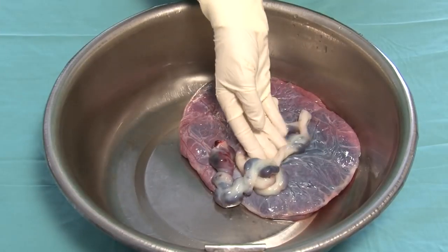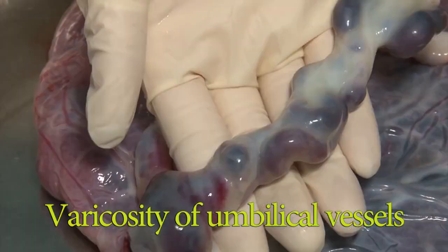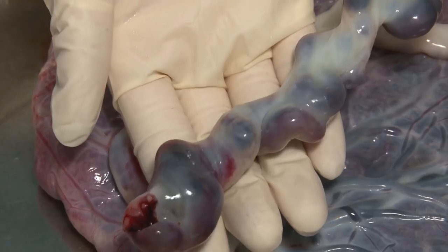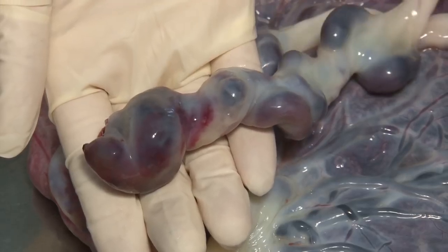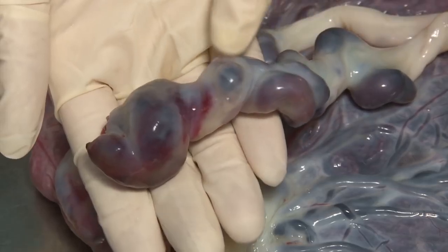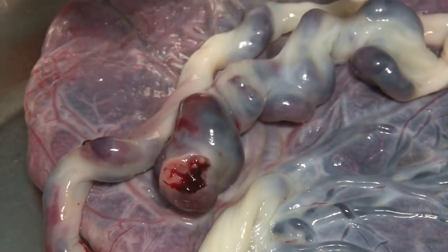In this case, a marked varicosity of the umbilical vessels is present. They contain blood clots, which could have been caused by compression of the cord due to prolapse or head compression. Another etiology is fetal hypercoagulation due to sepsis or thrombophilia. The vessels are dilated and the presence of thrombi is abnormal, requiring further investigation.